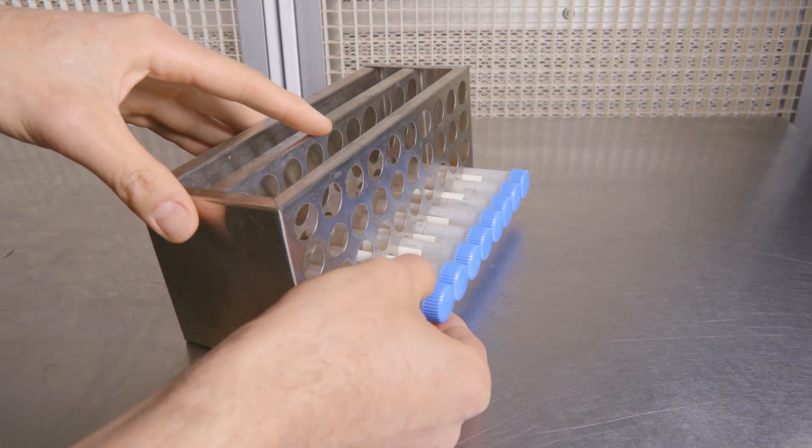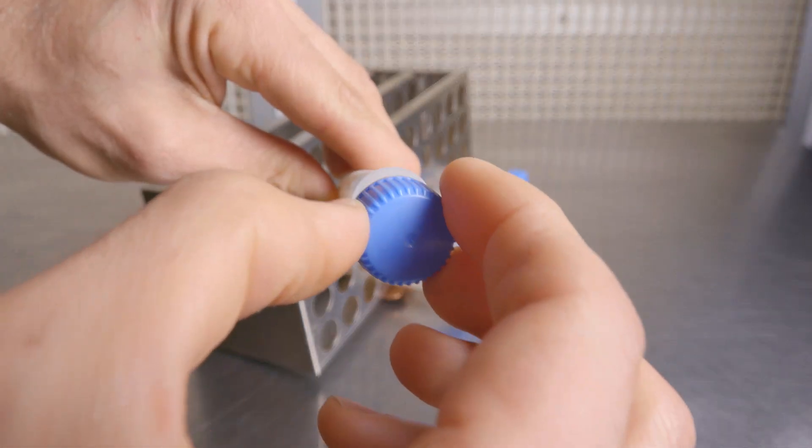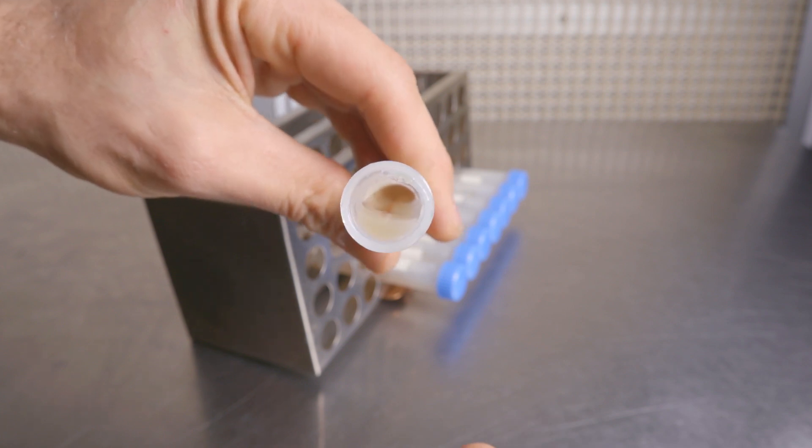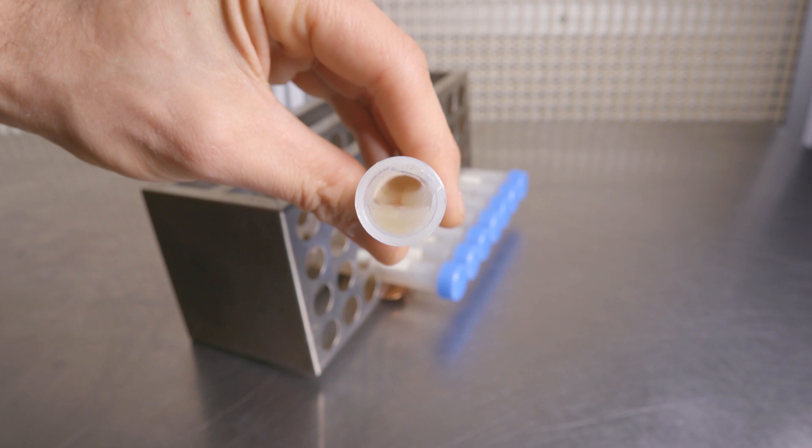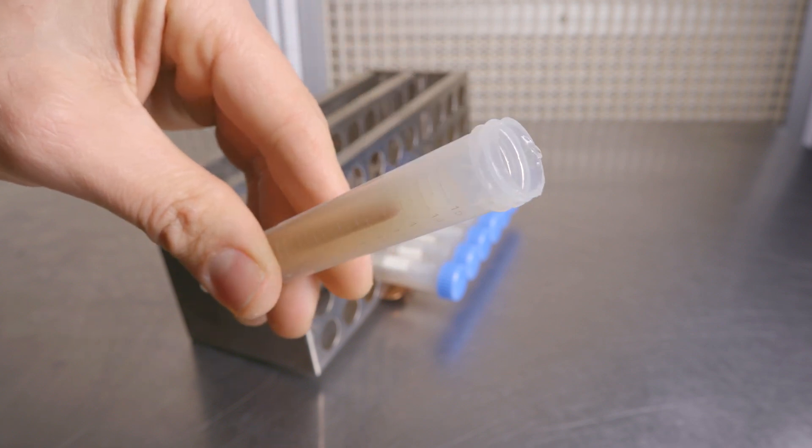Now it's time to have a look at our slants and see how they turned out. So it seems that we have a great slope for our mycelium to colonize along. Our stick is embedded in the agar so we'll need to slice down into it while placing our transfer so that way our mycelium will reach it.